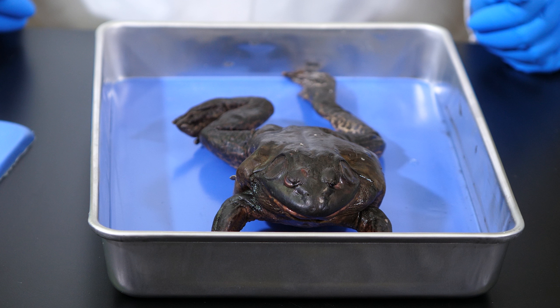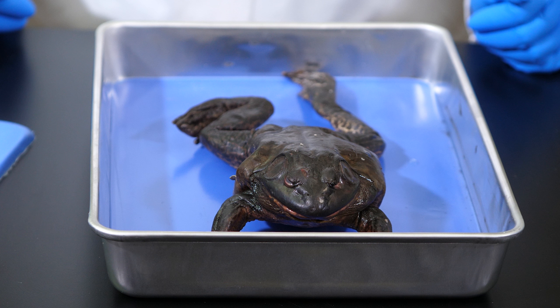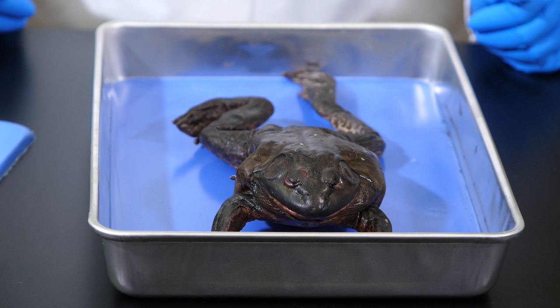The first step in the study of an animal's anatomy is to examine its general features. In this way, we can determine its body shape, skin color, gender, and the number of appendages.